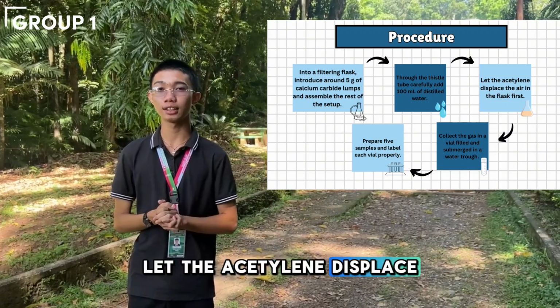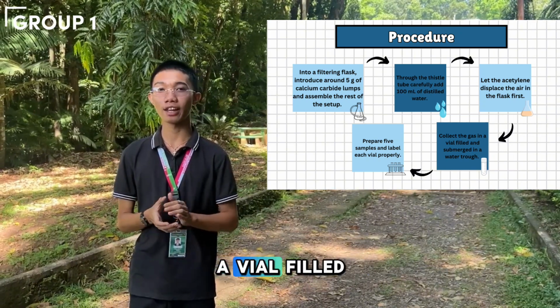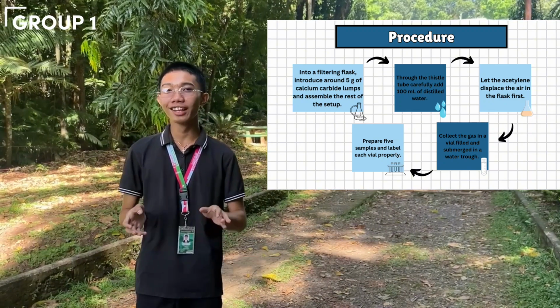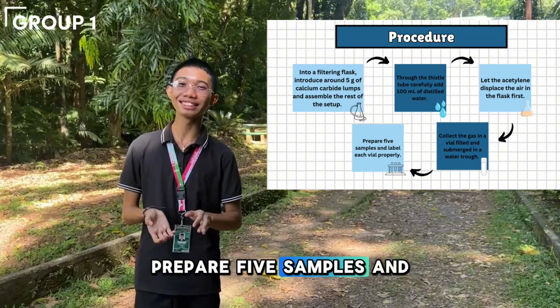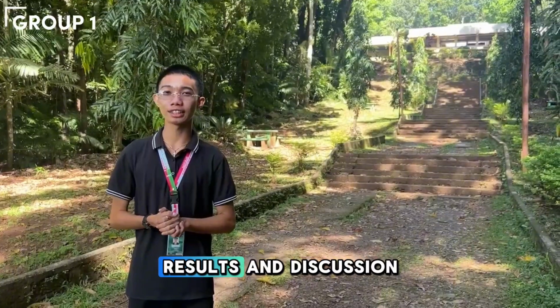Let the acetylene displace the air in the flask first. Collect the gas in a vial filled with water and submerged in a water trough. Prepare 5 samples and label each vial properly. Moving on to the results and discussion.